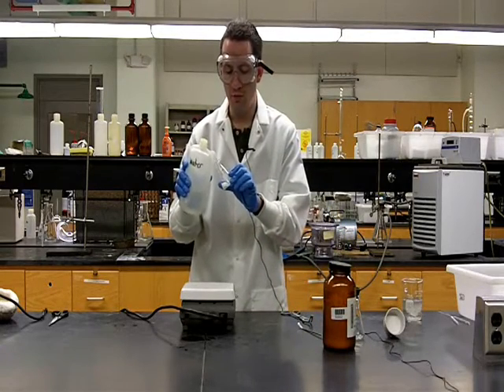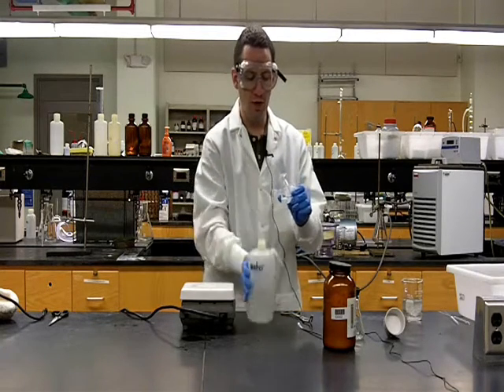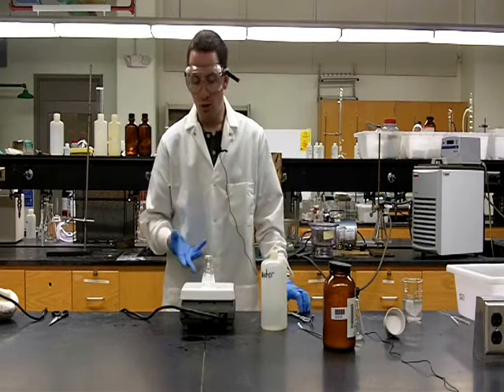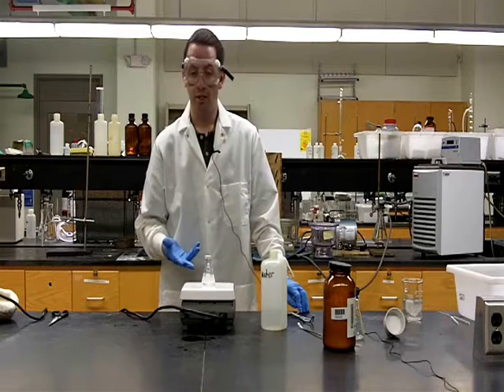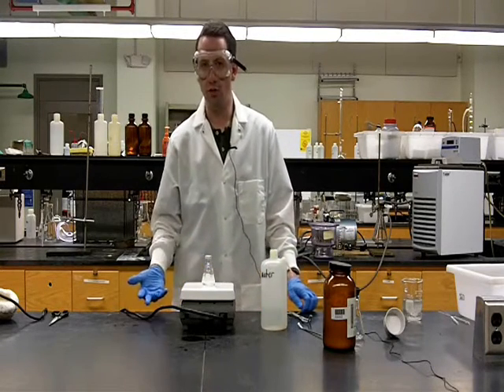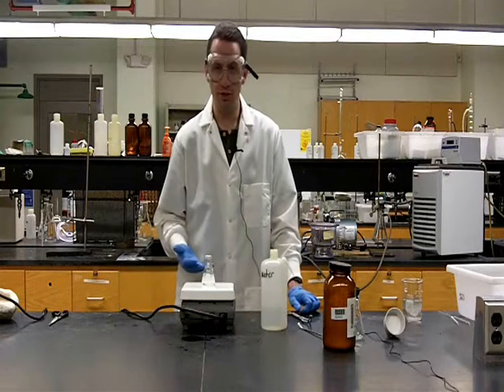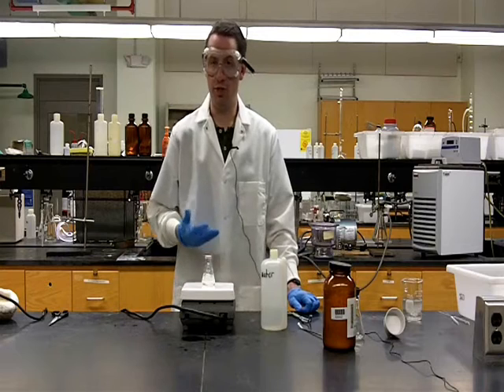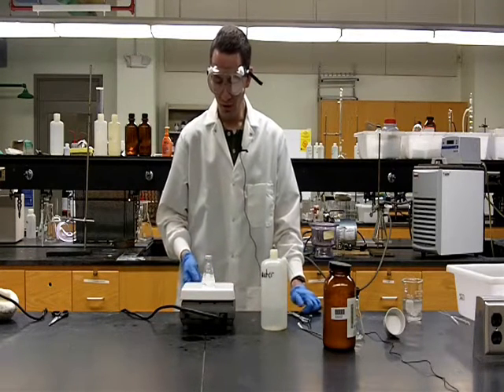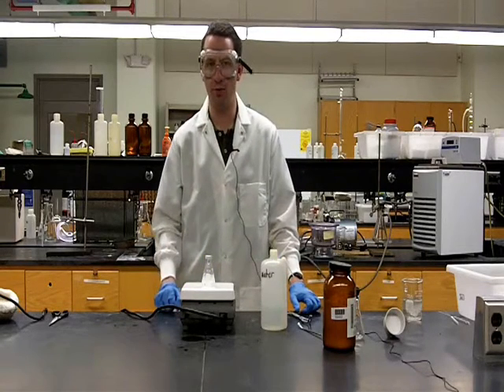The exact amount of water we add is not all that important because we're going to adjust that as needed throughout the recrystallization. If we find once the water comes to a boil that not all the benzoic acid has dissolved, we'll add additional water. But if we find that it has dissolved the benzoic acid too easily, that may mean we've added too much solvent and we need to boil some of the water off. So now we have this on our hot plate and we just need to wait for the solution to come to a boil.